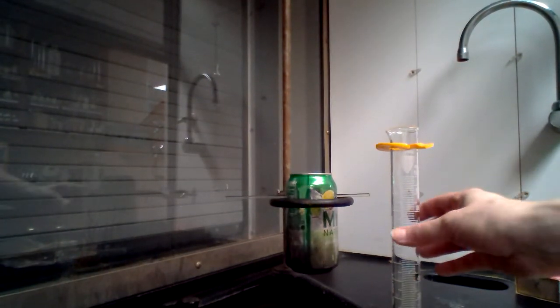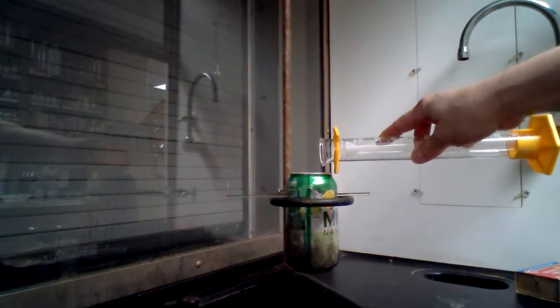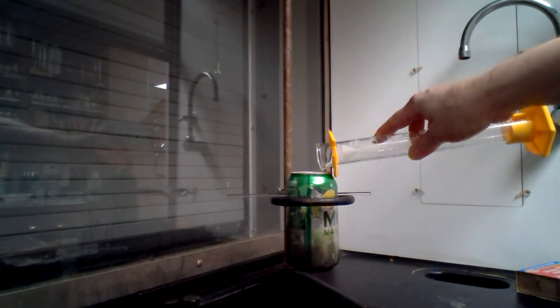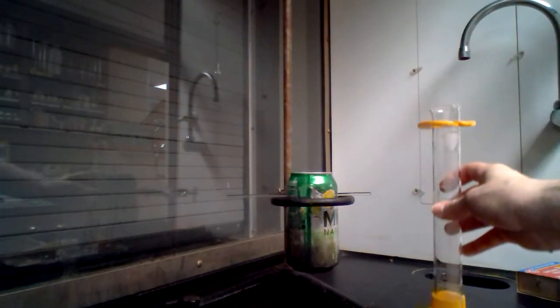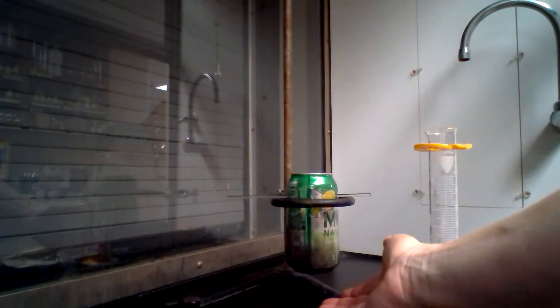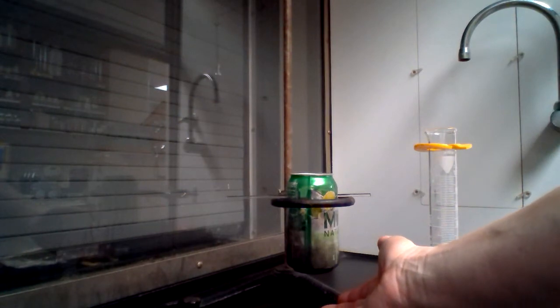So you're going to record that measurement and pour the water into the pop can. This is going to serve as the heat absorber.